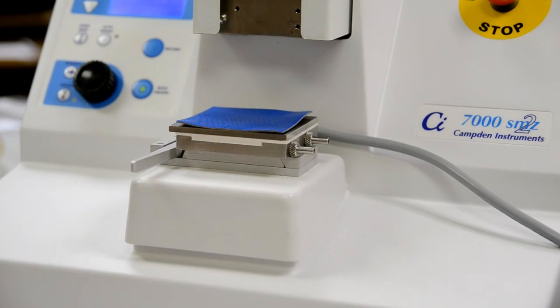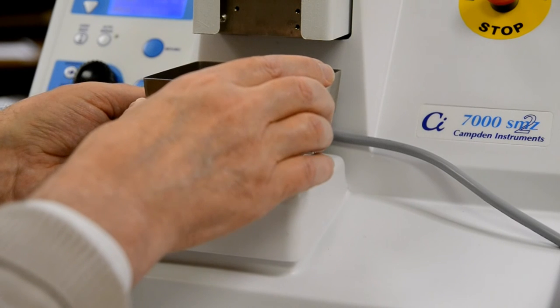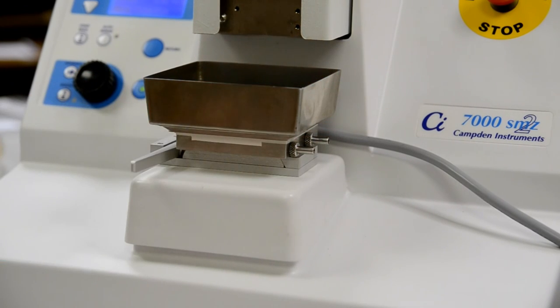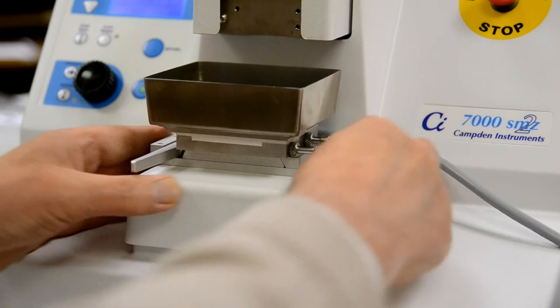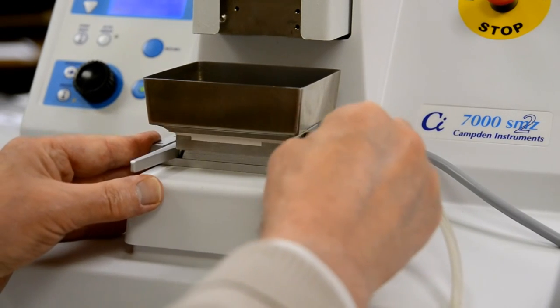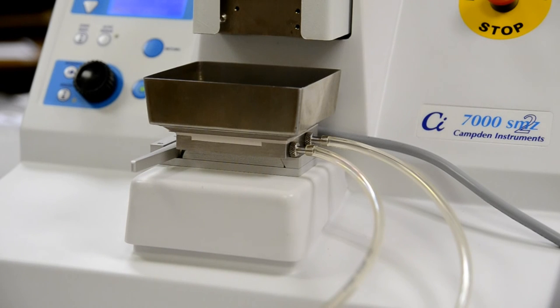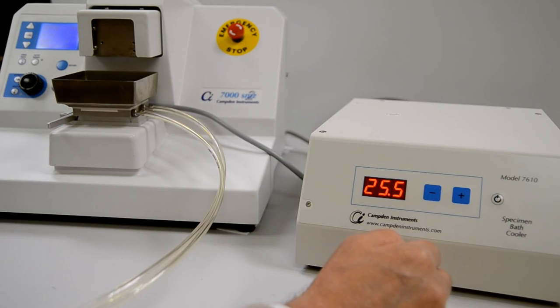Place a piece of the supplied thermal transfer pad to the top of the cooling unit and then fit the standard inner bath. The cooling unit must be connected to an adequate cold water supply. Connect the unit to the controller and press the on-off button.